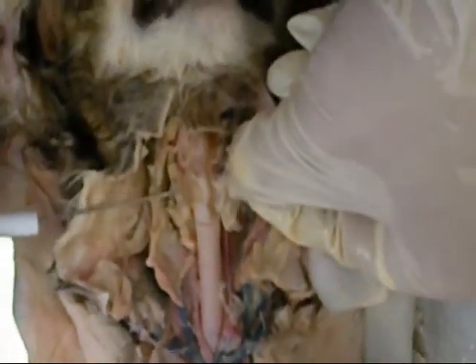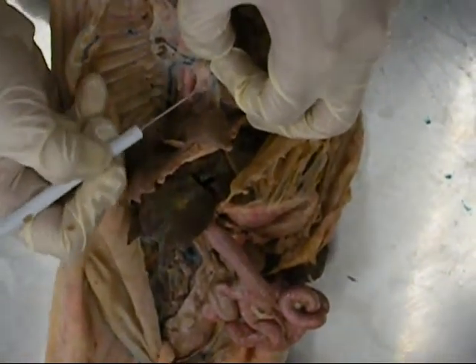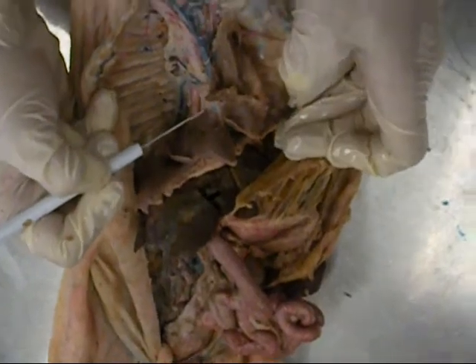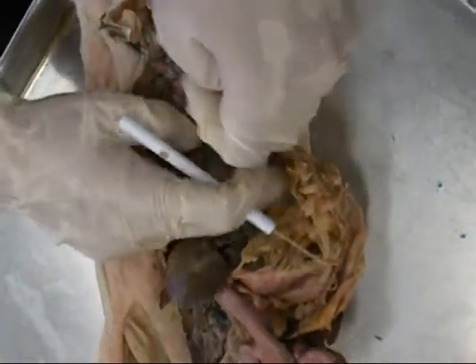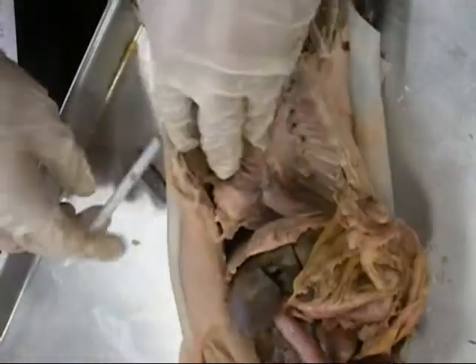So we have the two lobes of the thyroid gland, then the trachea. The trachea divides, though this never got dissected out, to form the right and left primary bronchus. So again, you can hear the cartilage as I run across the bronchus. The right primary bronchus enters the right lung, and the left primary bronchus enters the left lung. You'll find those bronchi on the posterior side of the lungs.